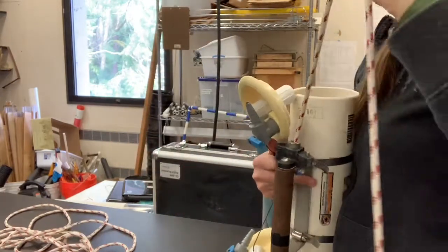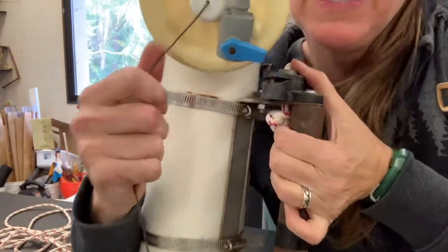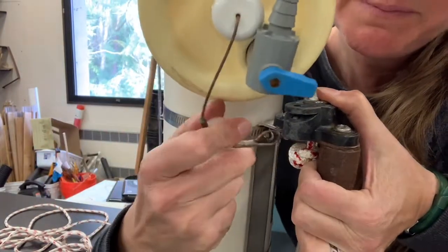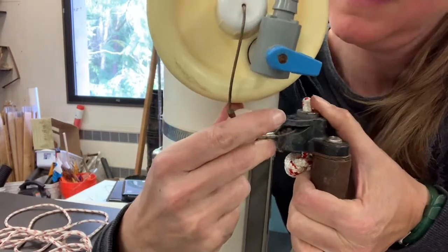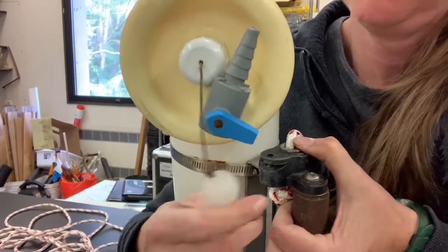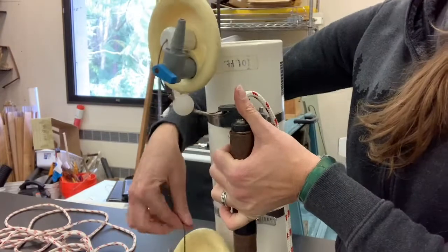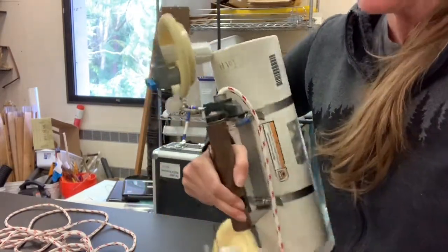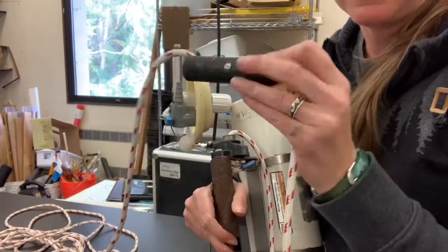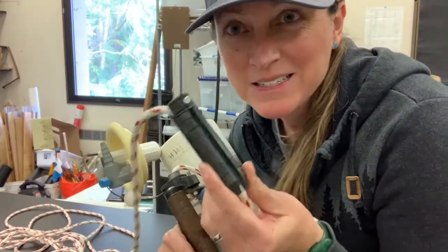If the mechanism were working correctly, what you can see here is this little pin that goes down. I would put these pieces in and then let go, and the pin, when it lets go, is going to let that fly. So what happens is you lower it down on the rope and you have this thing called a messenger — and I love that name, messenger, because you're like sending a message to the bottle.